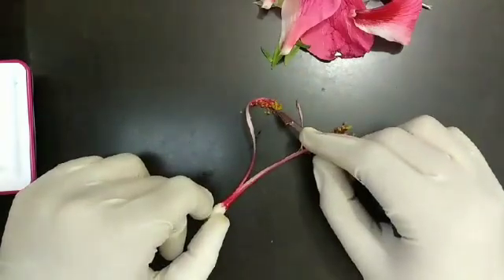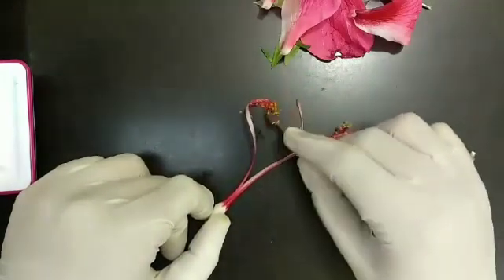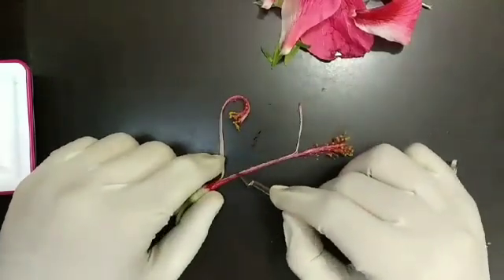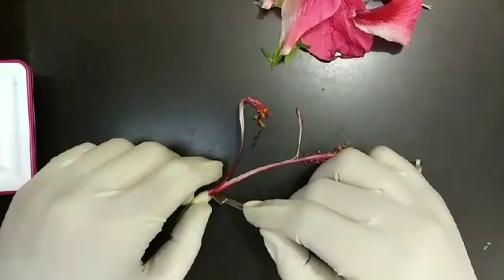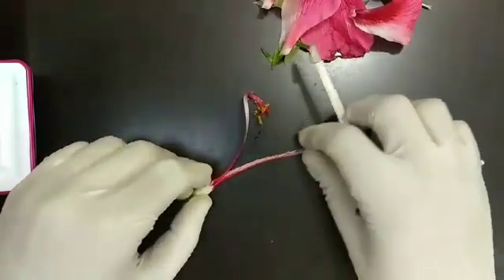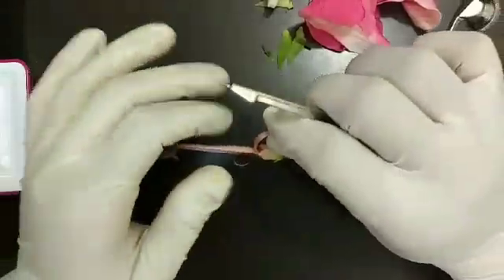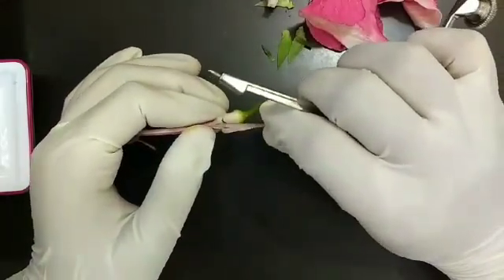This is the male part of the flower which contains the pollen. We have divided the style into two parts. Now we are going to remove this area to get the ovary.